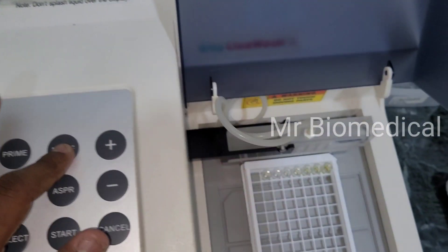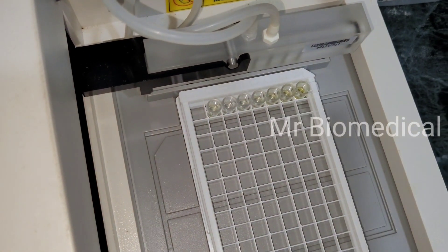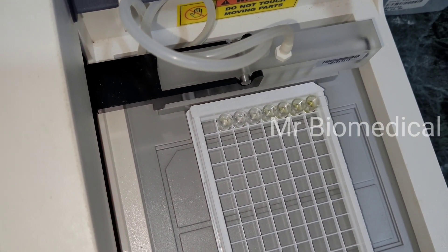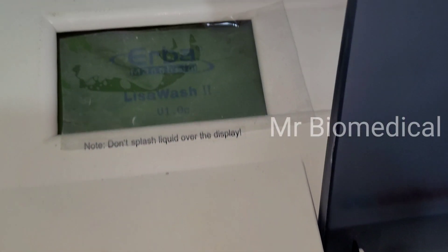So this is the problem, let's see how to fix it. I'm Praveen Rajagopal and this is Mr. Biomedical.